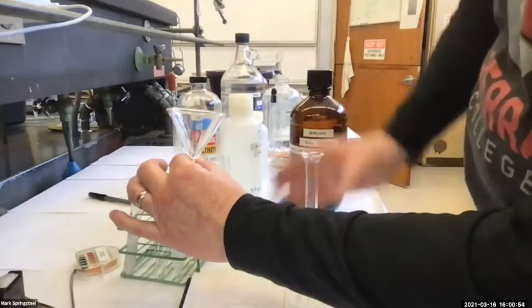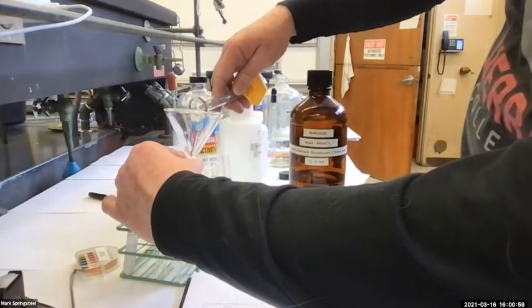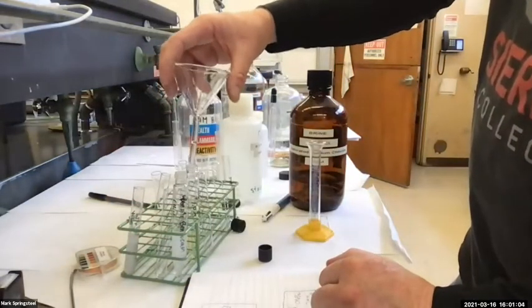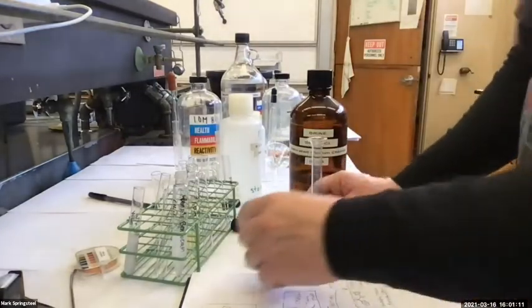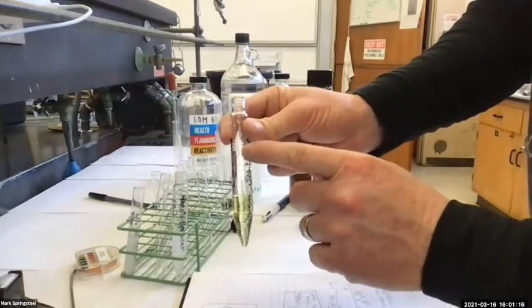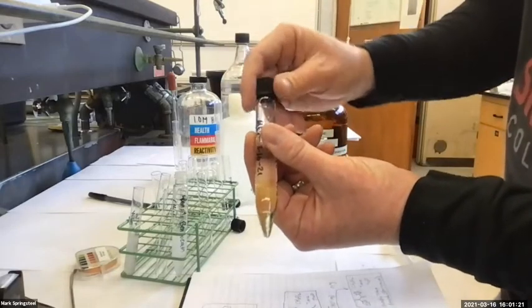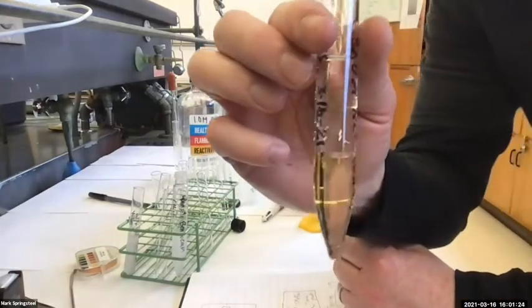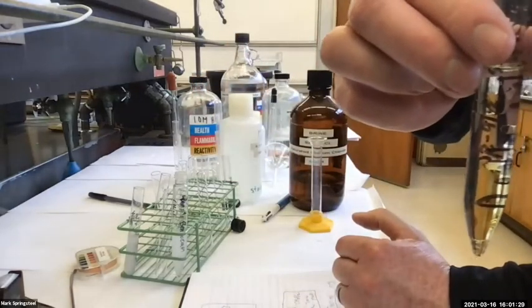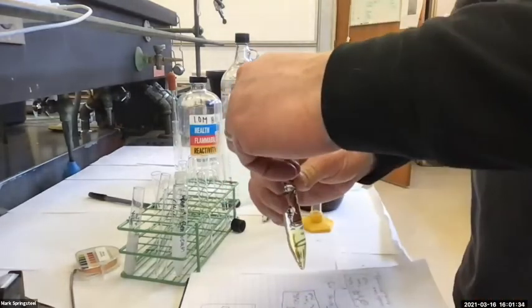Now I'll add that to my centrifuge tube. I might add less than the full 6. Let's see how it looks. Ah, this looks good. That's fine. I just wanted to make sure my centrifuge tube didn't get full. Got that ready to go. So the brine is on top, organics on the bottom. It might be hard for you guys to see, but try to look at that organic layer and remember how clear it is. Is it looking real clear or just kind of clear? Sometimes when you do the brine wash, it clears up. It kind of gives you evidence that it worked.